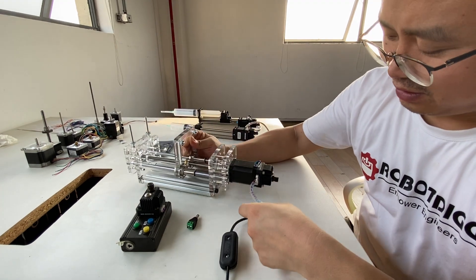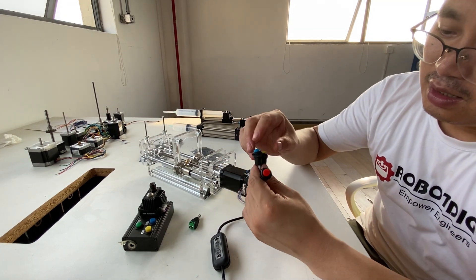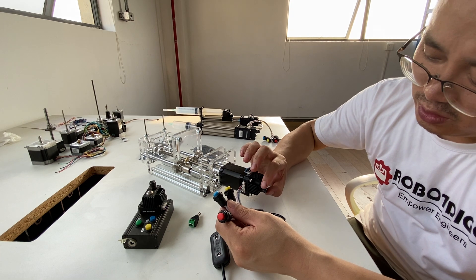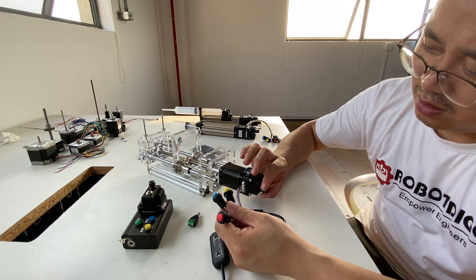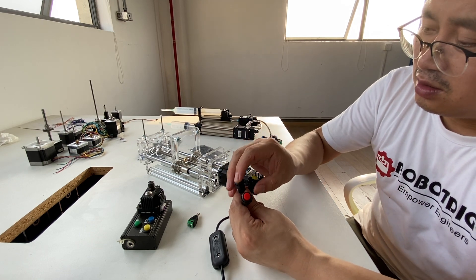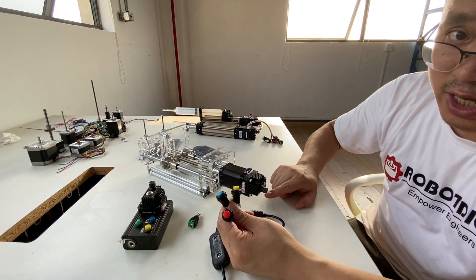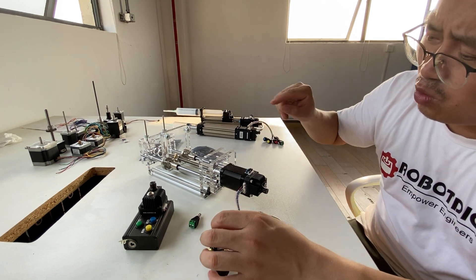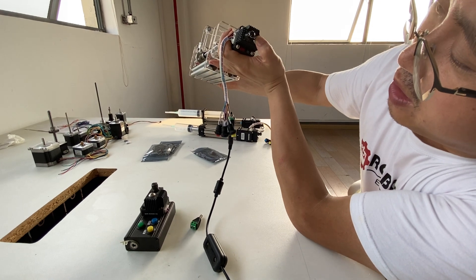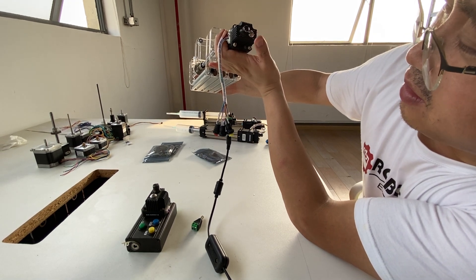Now you turn the potentiometer to zero again. When you turn the potentiometer to a speed, you see that it will go forward or backward. Give it a higher speed. I just turn the potentiometer to zero again. So I just want to run this length — we just need to press this button again until we read 'YF' on the screen, and then release the button.